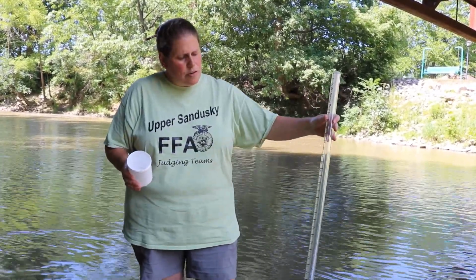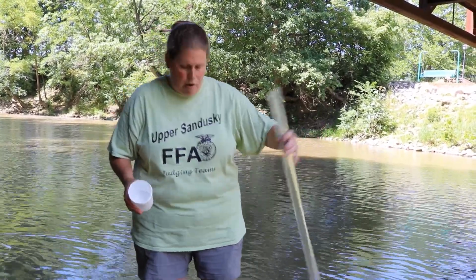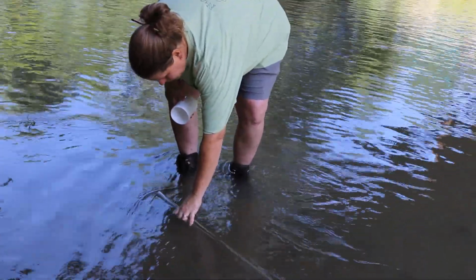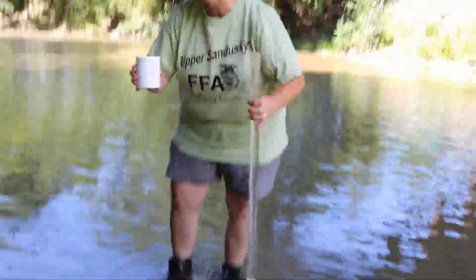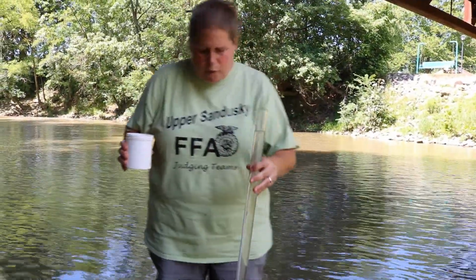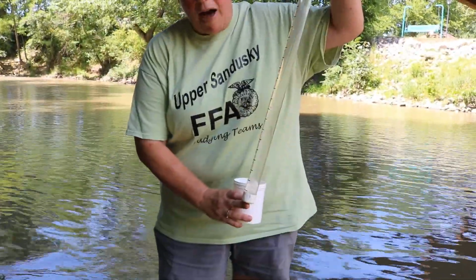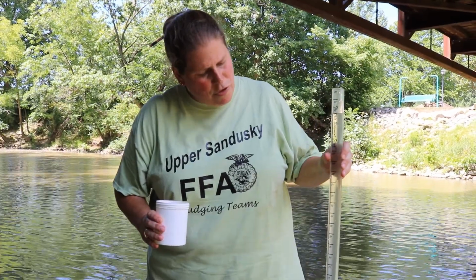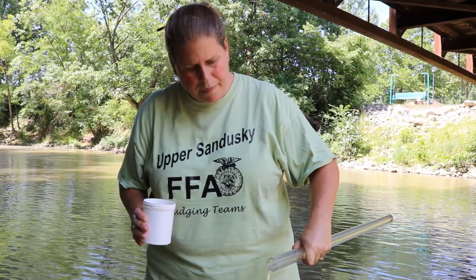So the way this works is we're basically going to see how much light penetrates through the water column that's in there. So we're going to start by filling our sediment tube. Let's take a sample in case I dump too much out. So what I'm going to do with this tube is I'm going to stare straight down into it, and there's a little black dot on the bottom of this. And I'm going to dump water until I can just see that black dot. And that's going to tell me how many inches of water I can see through to determine my turbidity levels.